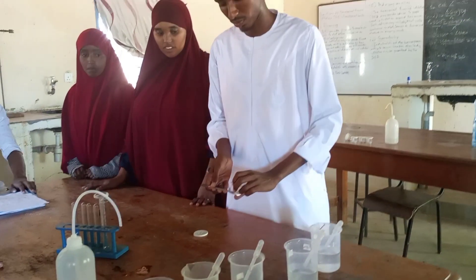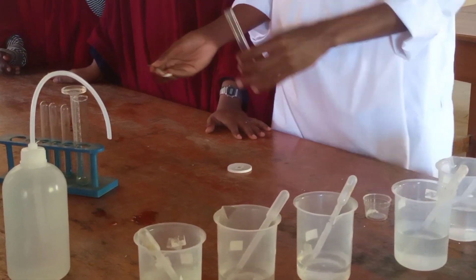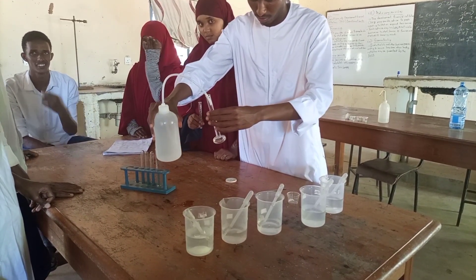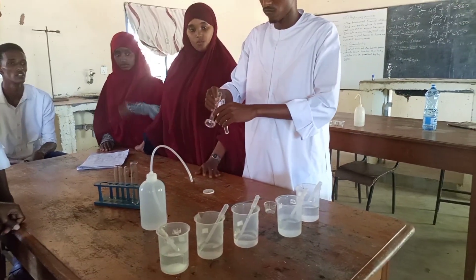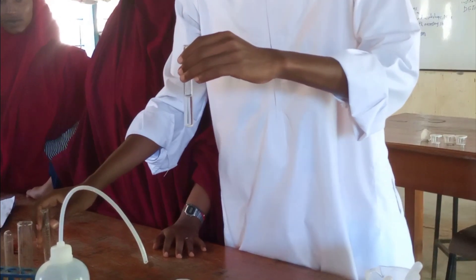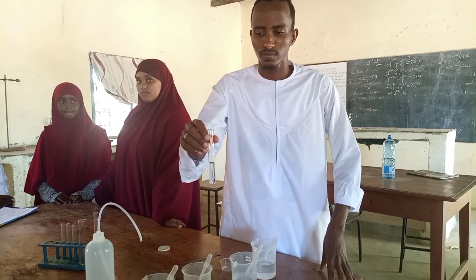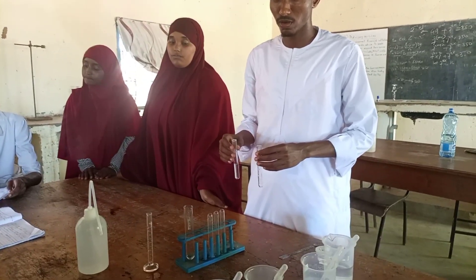Take a spatula full of solid N and put it into a test tube. Then measure about five cubic centimetres of distilled water using a measuring cylinder and add it into the test tube containing solid N. Then shake this mixture and make your observation.